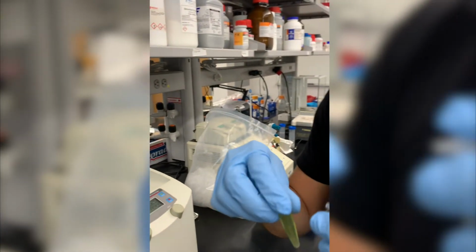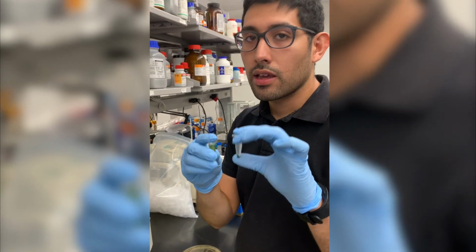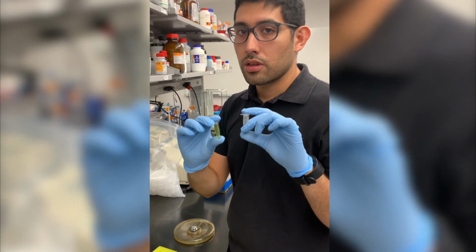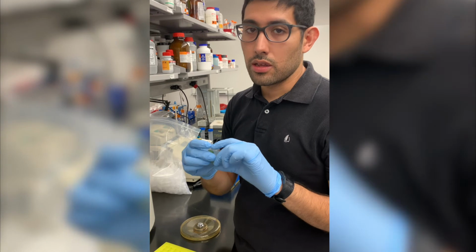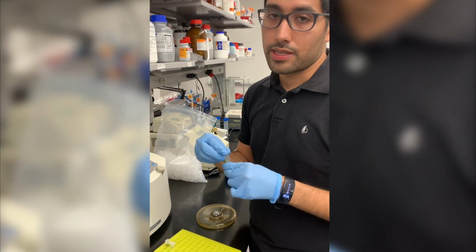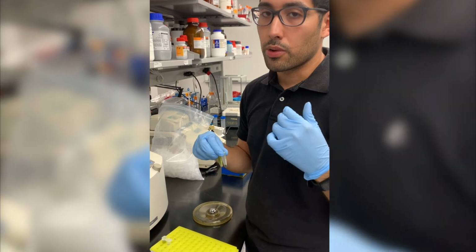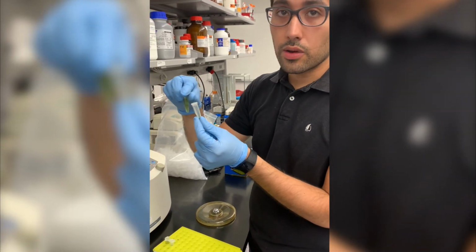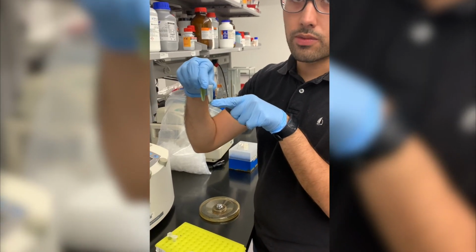Now, if you want to obtain biofuels from these, you need to properly select the liquid that you need to use to continue with the extraction. Depending on what you want, you use a different chemical. So, for example, if you were to obtain a biofuel, you will need to separate this liquid and work with the biomass, with the pellet.